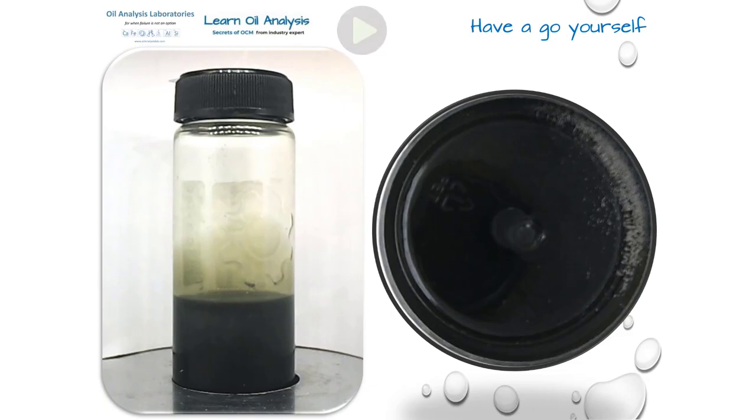This is a dark sample which looks like engine oil, but in fact is a gear oil that has turned black from oxidized iron particles in it. You can see on the right hand side the large metallic wear, and this was in fact from a gearbox failure.